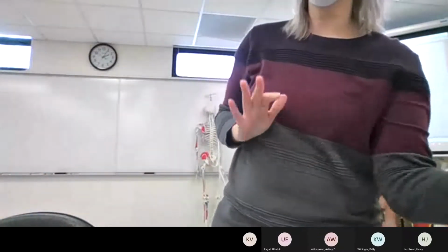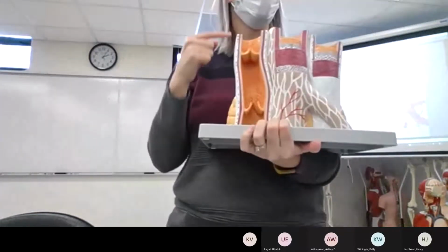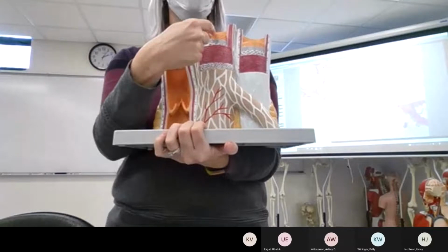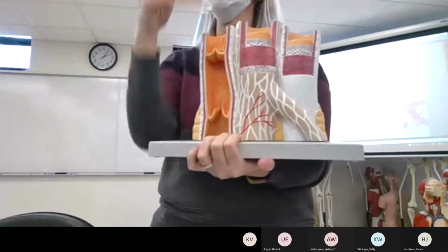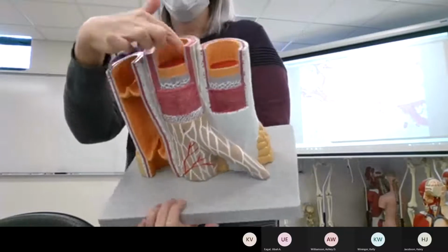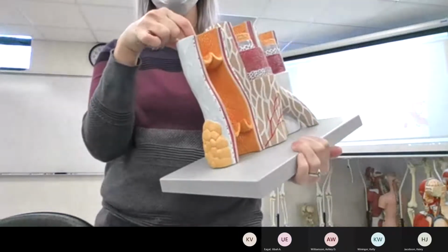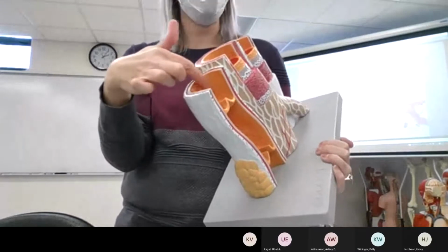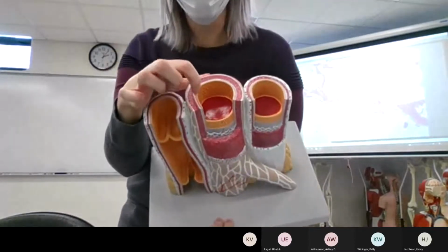While you're looking at it through the microscope, let's talk about some of the models that we have of simple squamous epithelium. Remember, simple squamous epithelium lines your blood vessels, where blood is always touching these cells. This model shows our different blood vessels. This yellow layer of cells makes the valves in our veins and touches the blood in our arteries, and it is represented as simple squamous epithelium. Looked at one way, they look like a bunch of flat little pancakes, a little honeycomb motif. In cross section, it's a thin little layer.